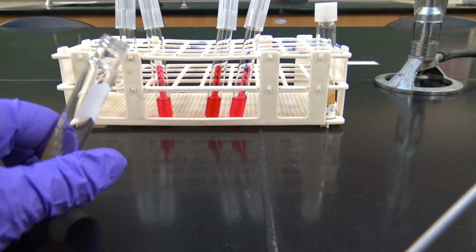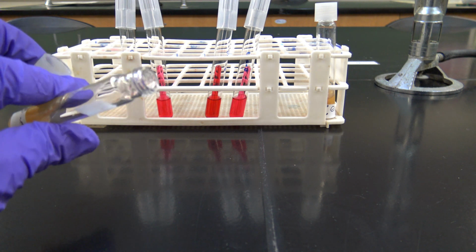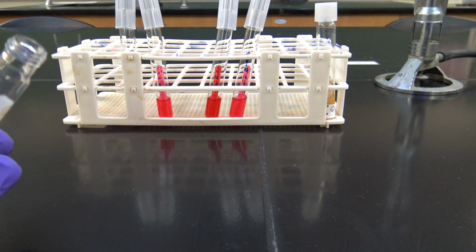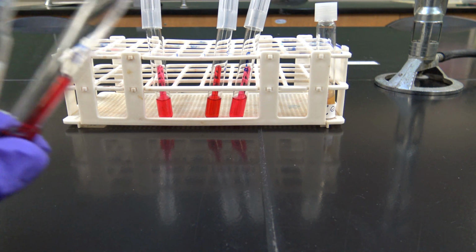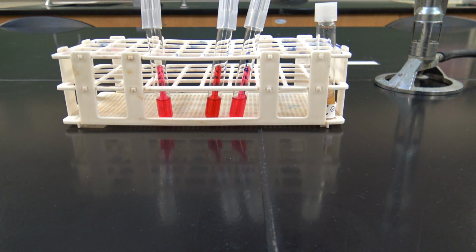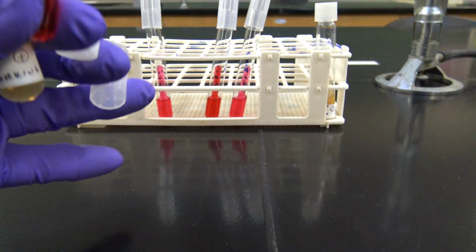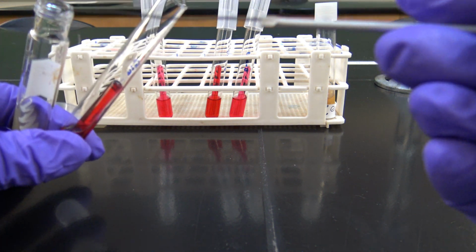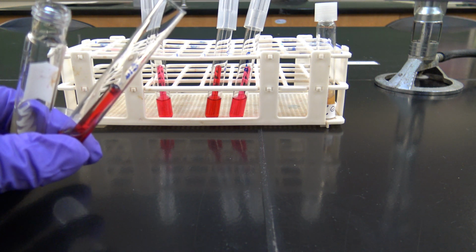Okay, and I'm going to hold that in one hand like this. My screw cap is between my fingers here, and my inoculating loop is in my right hand. Okay, so now I'm going to grab one of the glucose tubes. I'm going to also sterilize the lip of this in the flame. Place the cap between my fingers over here. So my fingers are pretty full here. I have my slant here and the tube that I'm going to inoculate right here.